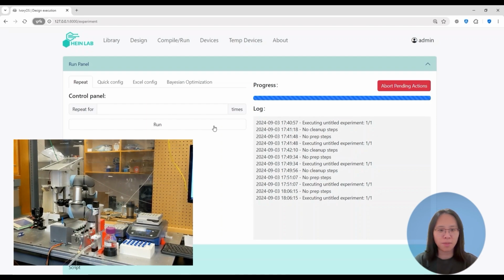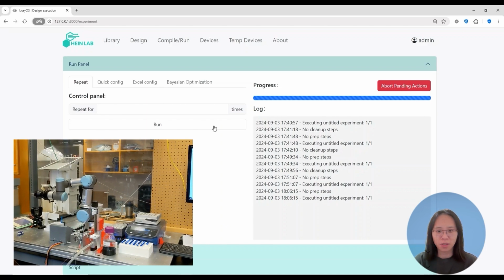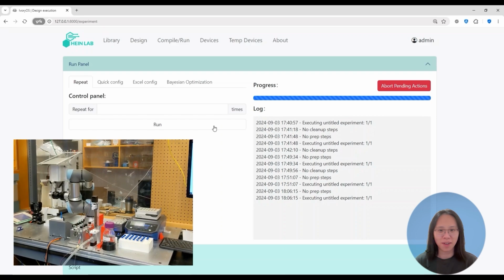After placing the vial holder onto the balance, the arm is going to back out, and the Quantos will close its door and take the weight reading of the current object. Once this process is done, the arm is going to pick up the vial, twist it back, and transfer it back to the thermal shaker. So hope this video can help, and enjoy the rest of the robotic workflow.